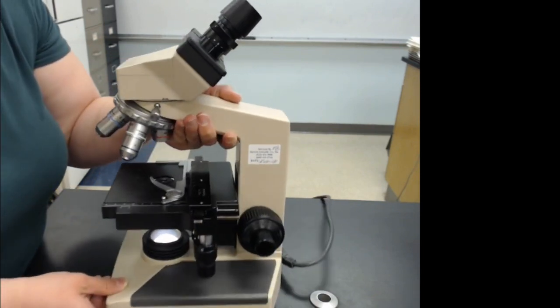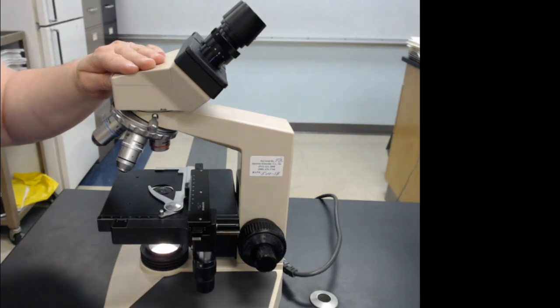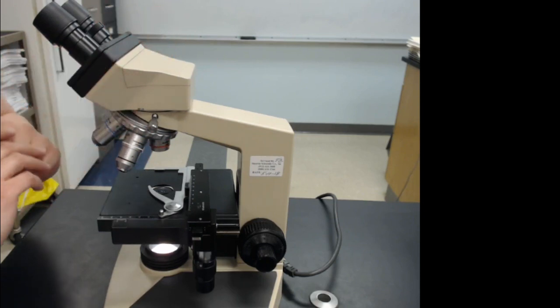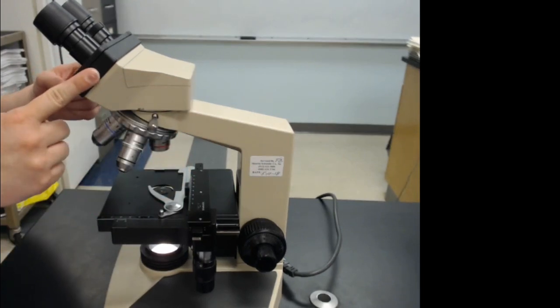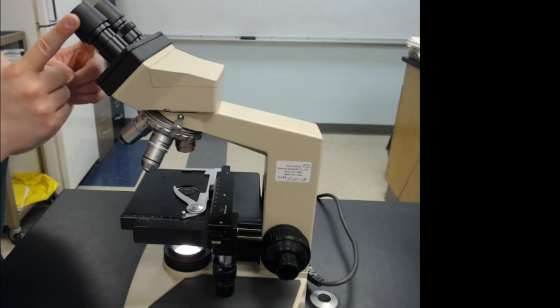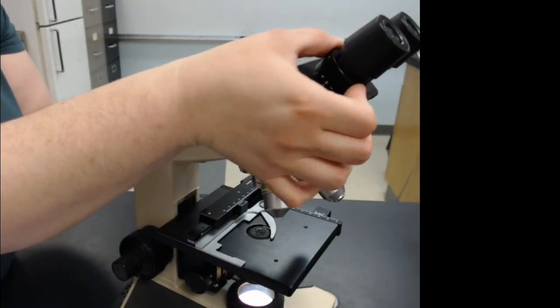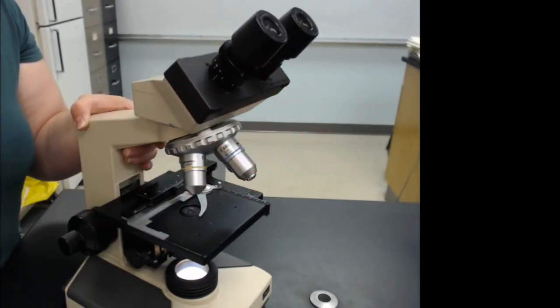The main body includes the arm and the head. The head can be turned around by unscrewing a screw — if you do turn it, you must tighten that screw or it can fall off, which is extremely expensive. You look through the oculars or eyepieces; if it's blurry in one eye, you use the diopter adjustment. You can see that it moves up and down — we'll go through that in a few minutes.